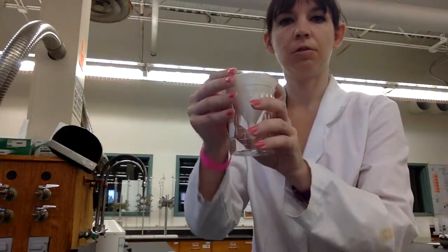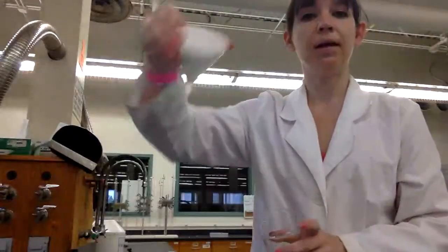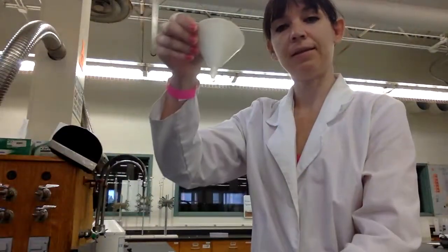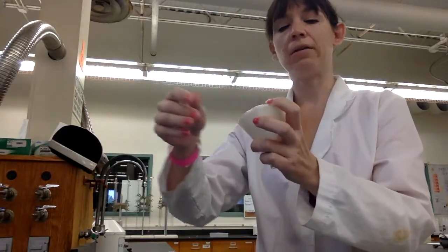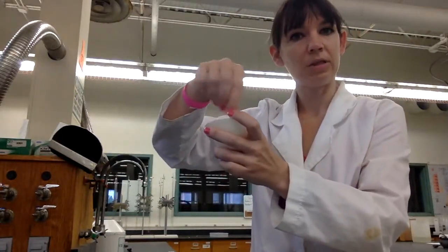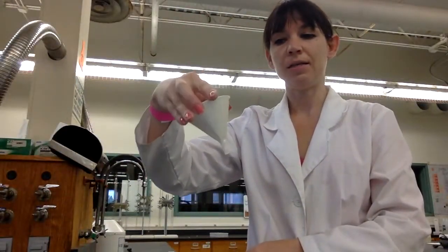And you're going to fit it into your funnel like this. And you can see now it fits perfectly. And what you're going to want to do to have it easily seat down in here is take your bottle of distilled water and just put a few drops around the outside of it, and that will allow it to stay in the funnel well.